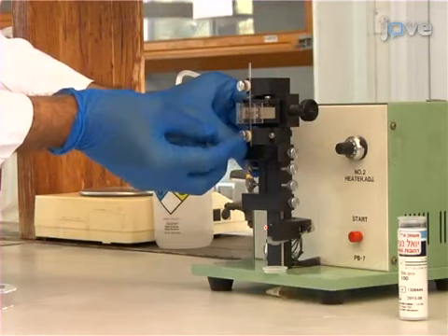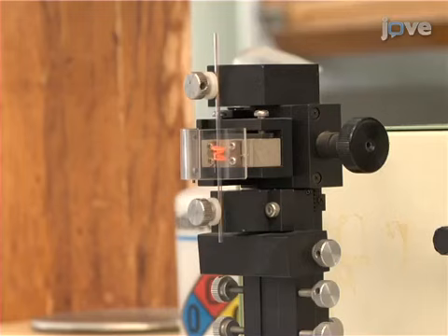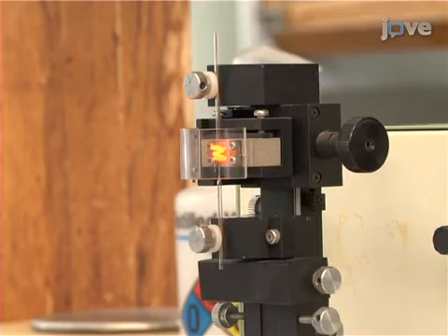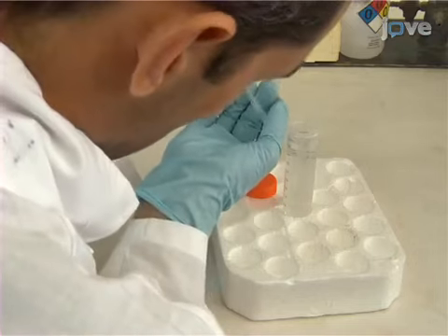To begin, prepare a glass capillary for solution injection. Use a capillary puller to prepare a sharp pipette with a fine opening from a glass capillary microtube. The size of the opening should be verified by passing air through the capillary to obtain fine bubbling in clean water.